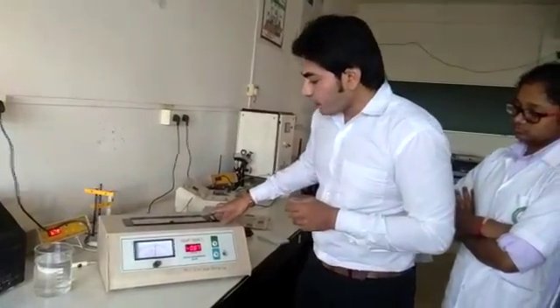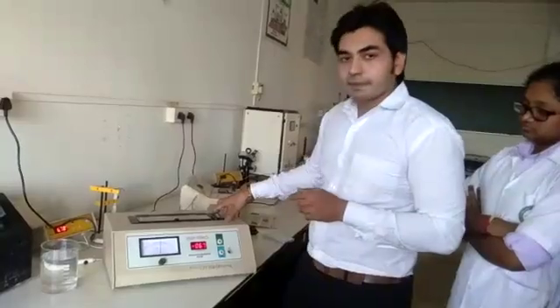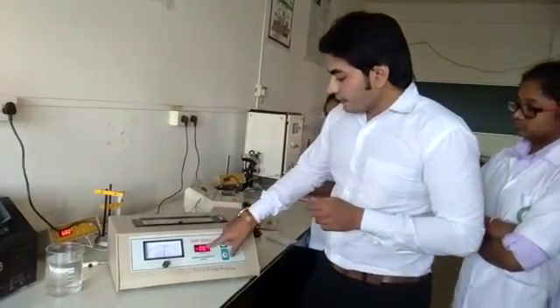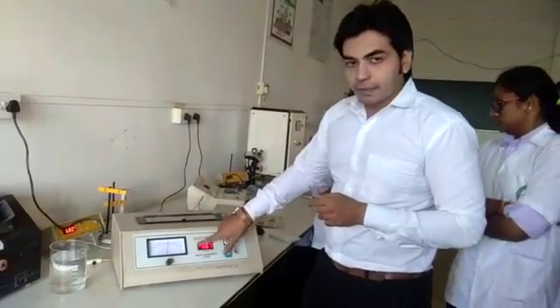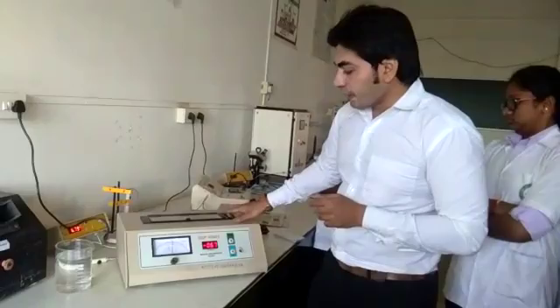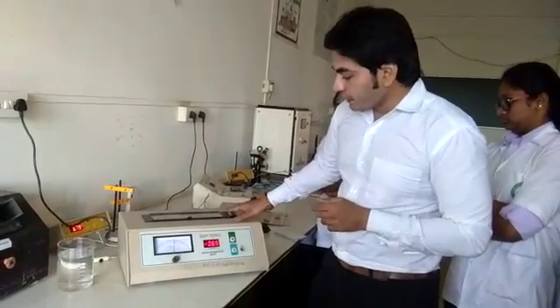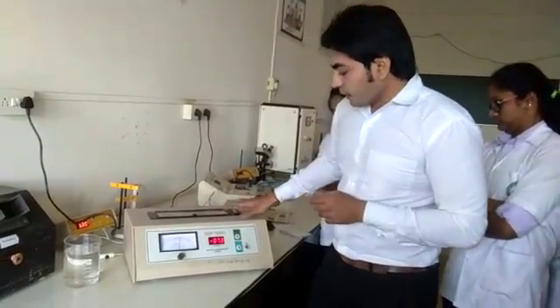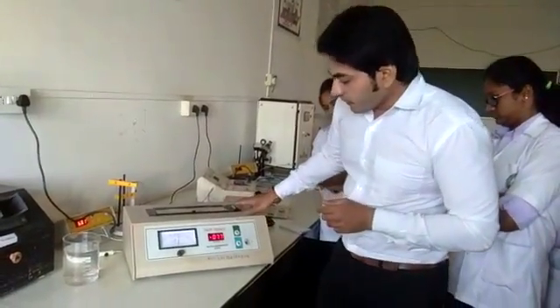Now let's see how to operate this instrument. You have to first set a zero reading on the display board.